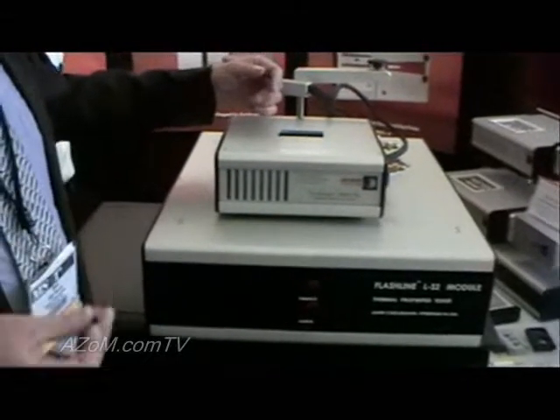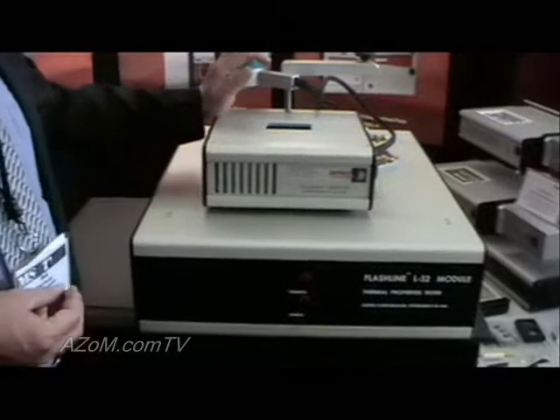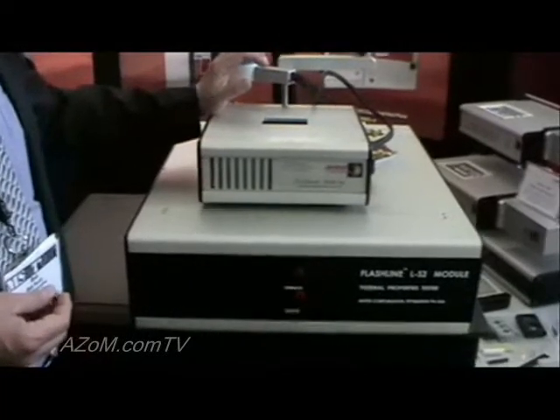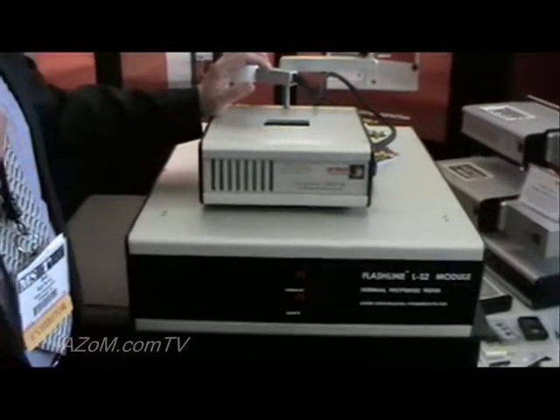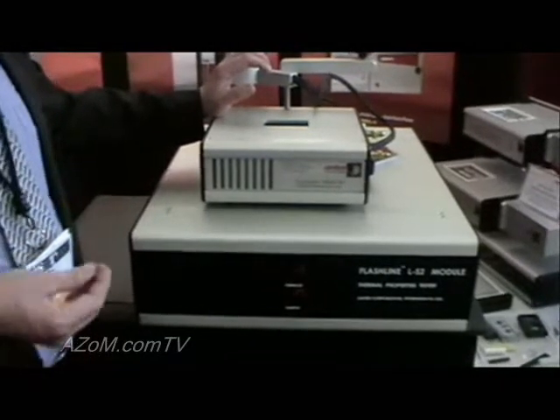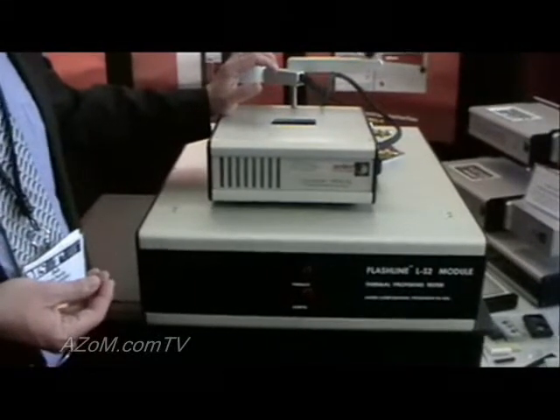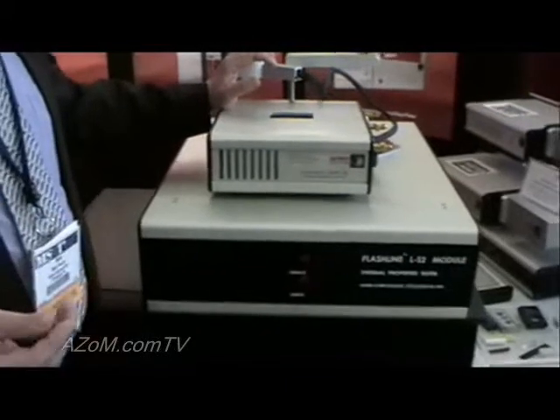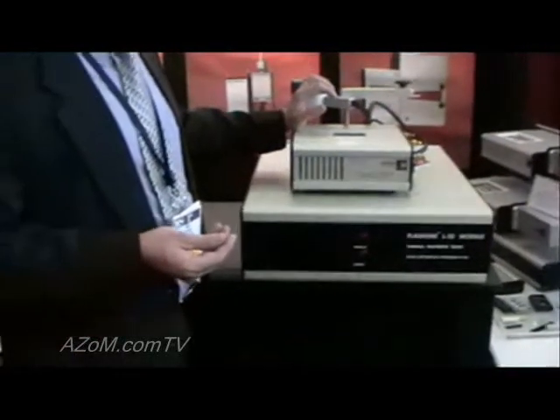It's a very fast measurement. Typically the measurement actually occurs within a fraction of a second, so we have the ability to quickly get to temperature, make the measurement, and automatically, through PC control, do a sequence of measurements at various temperatures in very quick succession.